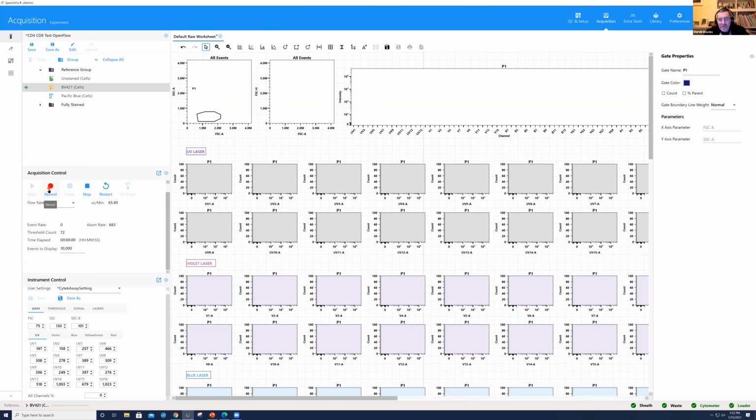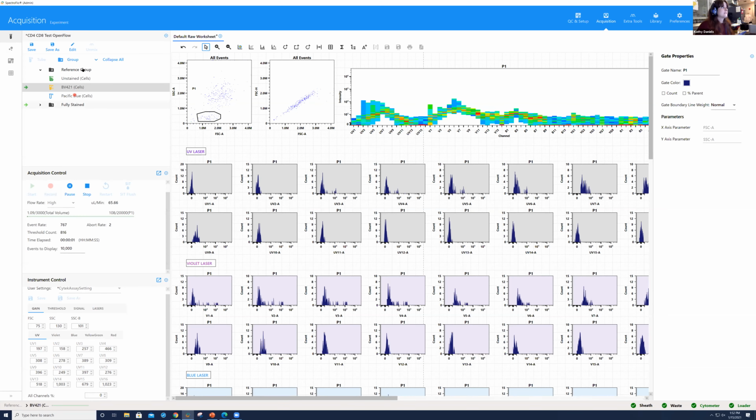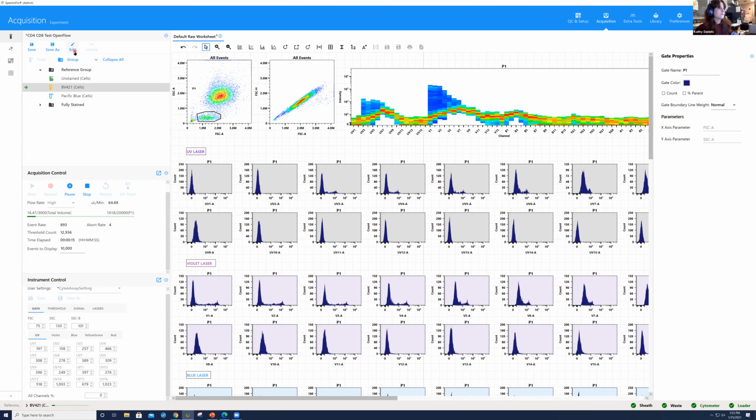So do you set, as another question, sorry, Kathy, do you set a volume to aspirate when you start this? That is in the initial settings. So if we went back to edit and we were looking at the original experimental setup, you do have the option to stop at a certain volume or a certain time. I have about 300 microliters in here. So I could have theoretically said I want to stop at, maybe 150, give myself a little bit of extra volume just in case. I prefer to use that when I'm working with plate mode. If there's a certain volume I want to work with, I don't typically tend to do the volume stopping for tube, but that's personal preference, but you absolutely can.